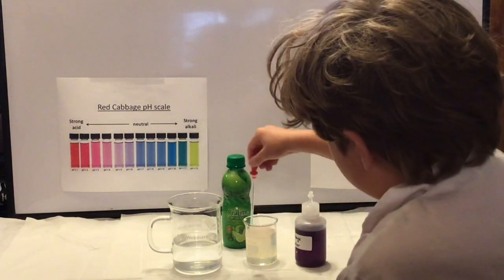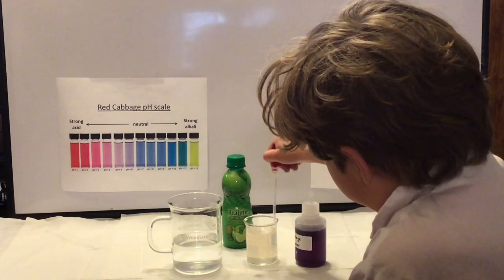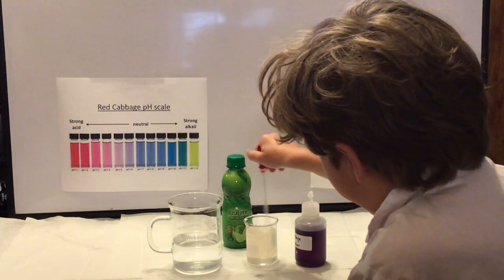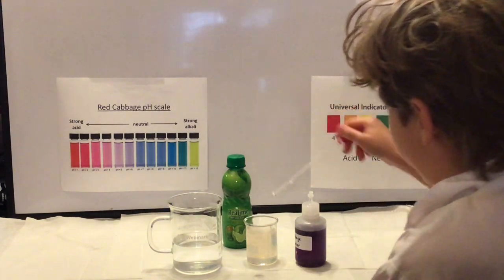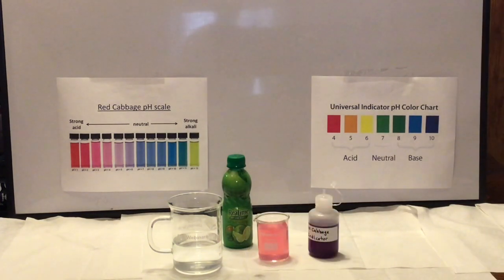And so after he got done stirring here, we realized that we needed to add more to really see that color. And so we stopped recording, added enough, and kind of decided how much we're going to take. And you can see once we've added enough, that lime juice forms something that's kind of pinkish in color, not quite red.